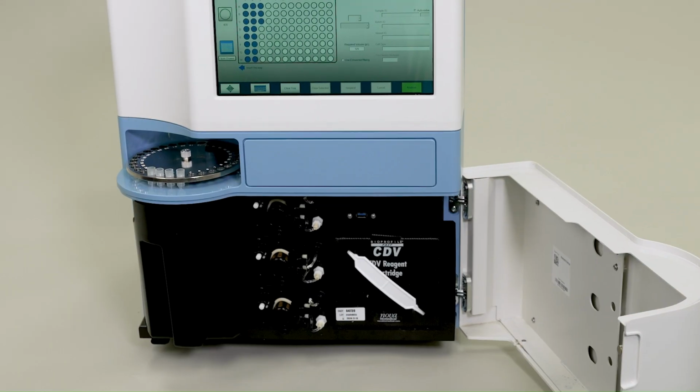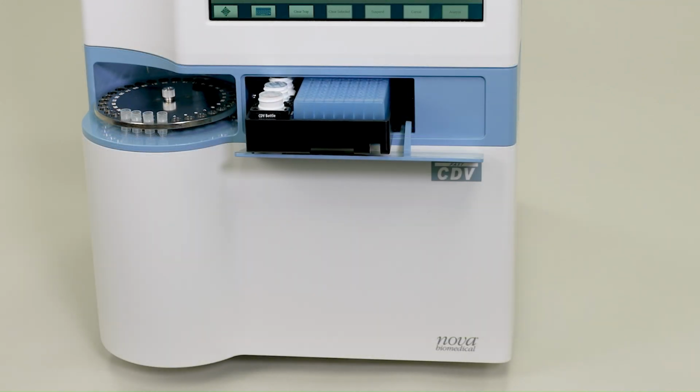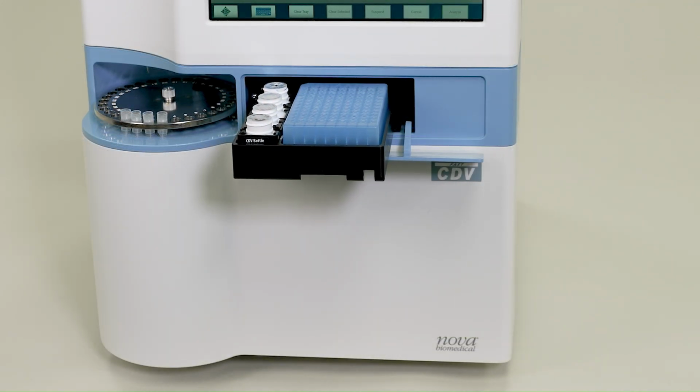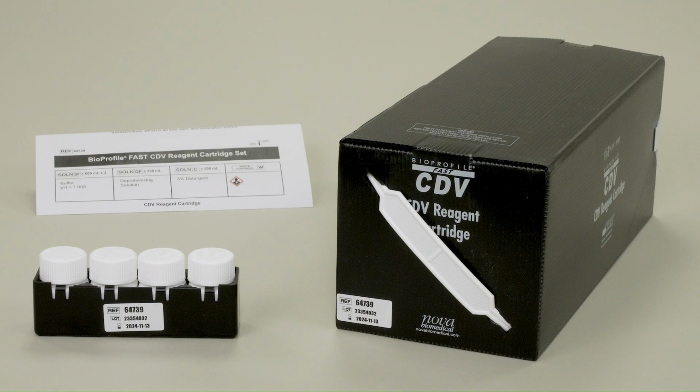When you open the FAST CDV analyzer door, you'll find the FAST CDV reagent pack, 3 pump tubing assemblies for cuvette A, cuvette B, and the waste well, the sample cup waste container, and a USB port. Above, you'll find the analyzer drawer, inside of which you'll find the FAST CDV bottle pack and the 96 well plate. Each of the reagent cartridges is equipped with a radio frequency identification, or RFID tag. This tag stores all of the use life information, including how much volume is remaining in the pack and when it will expire.